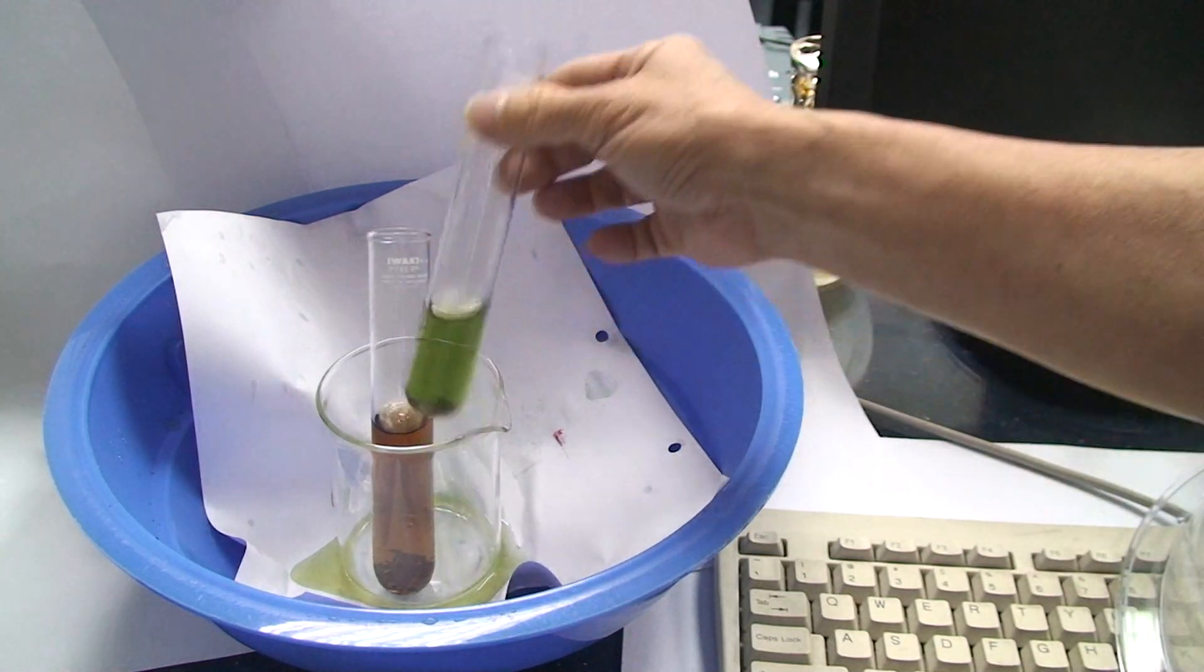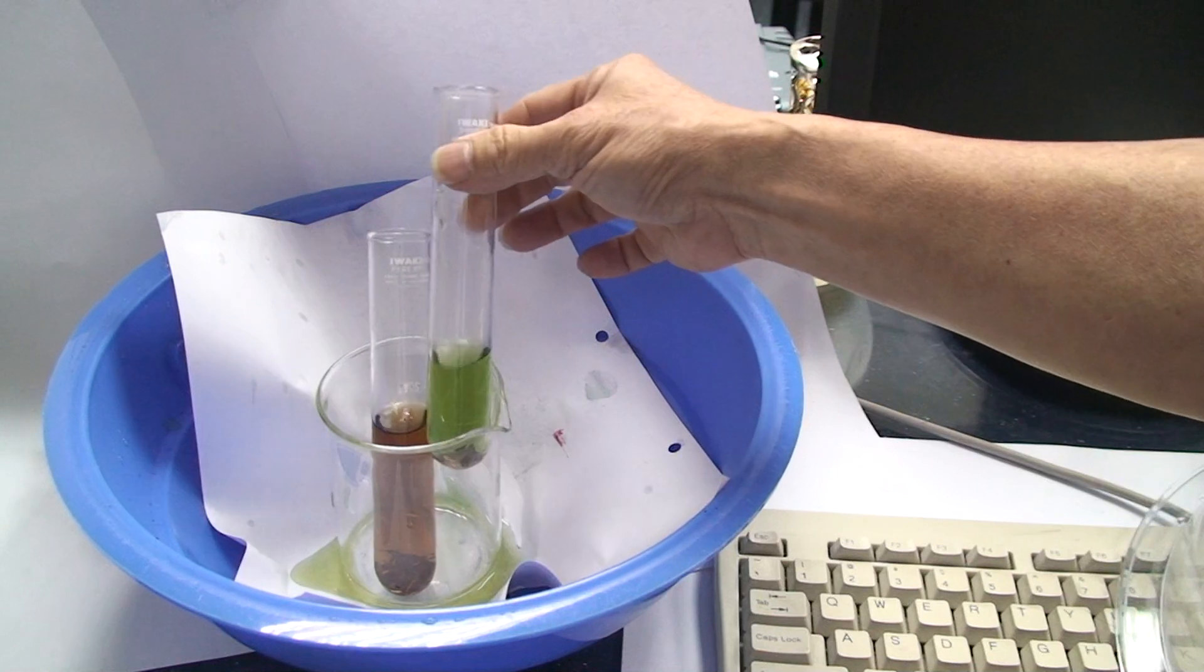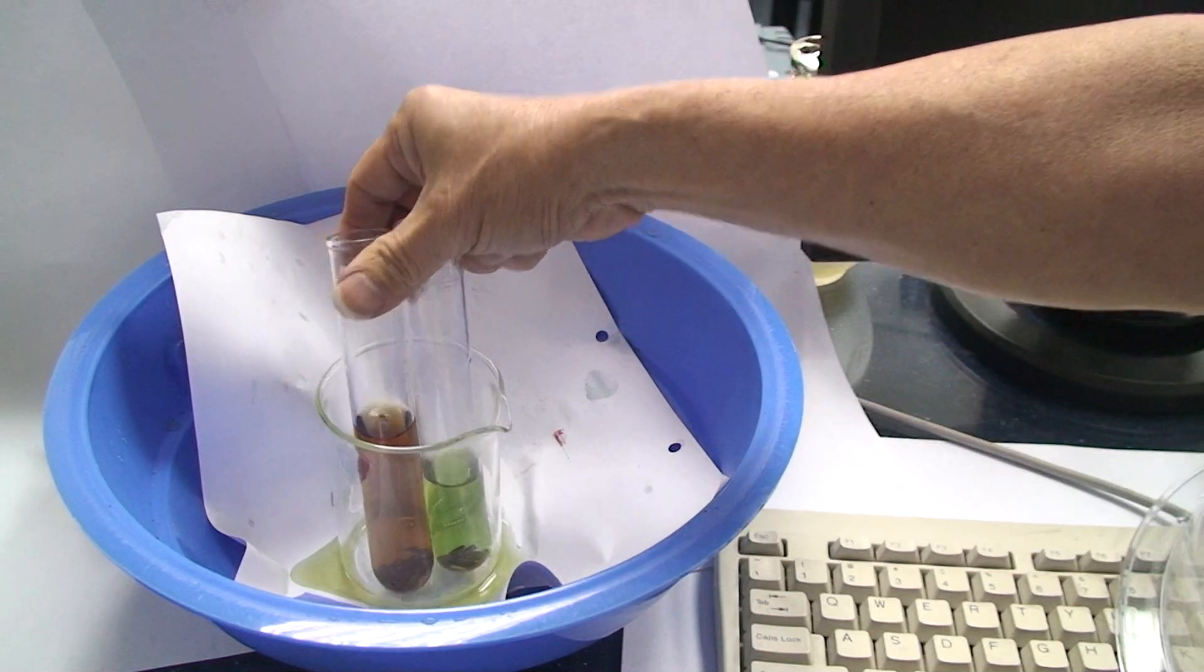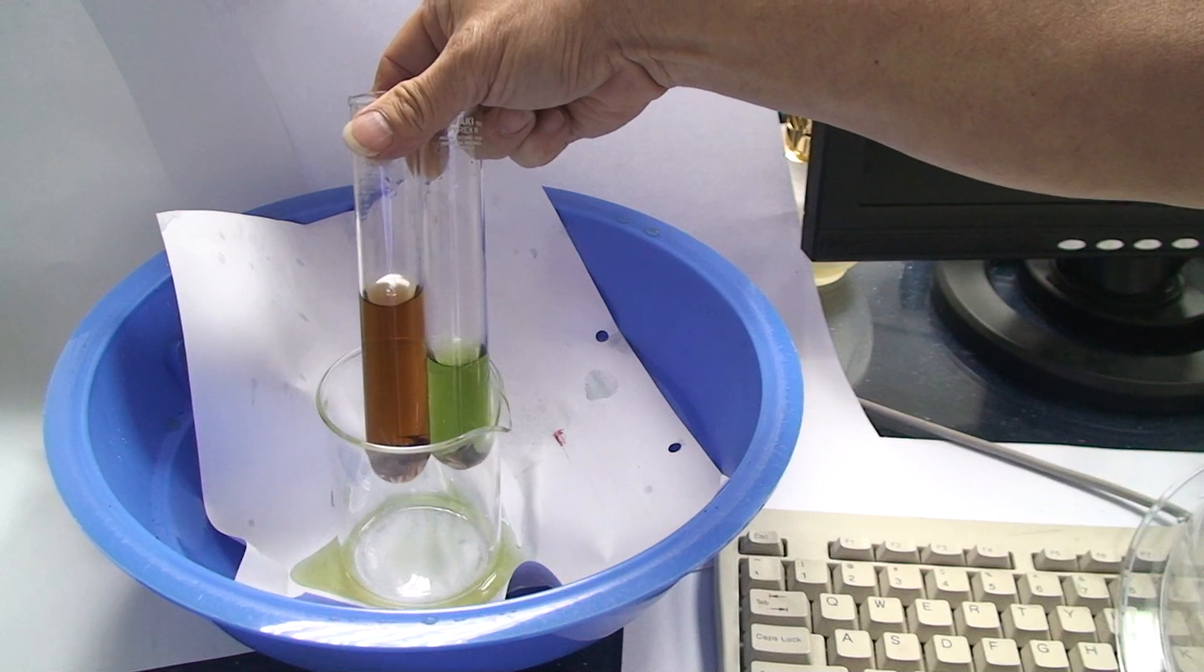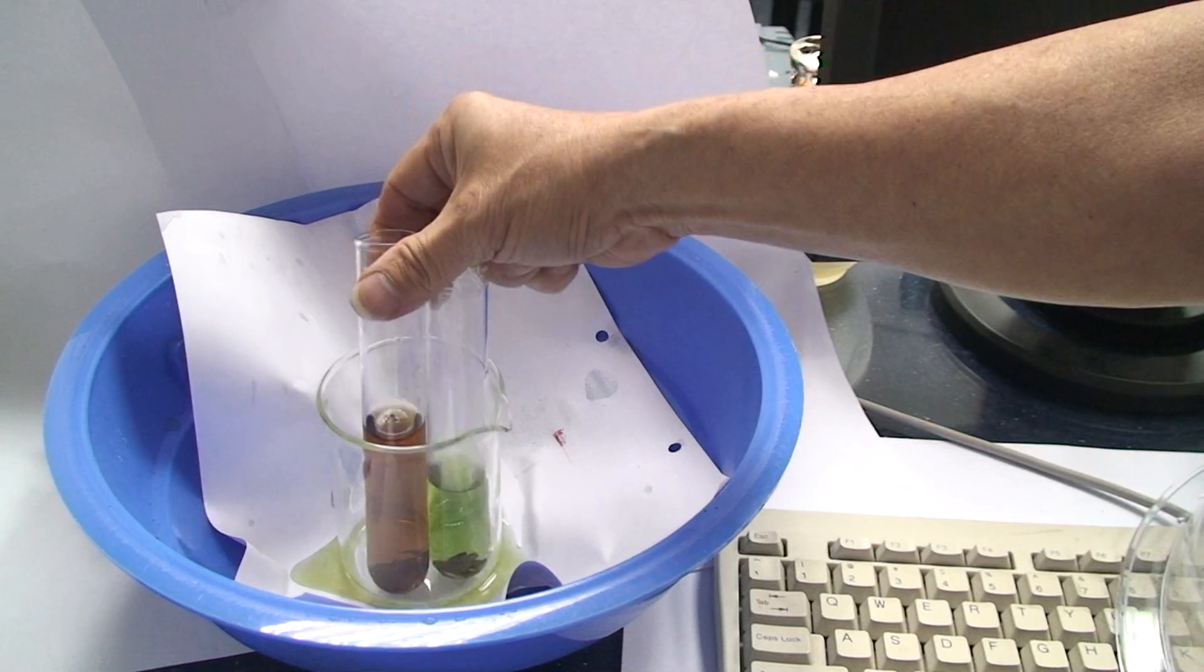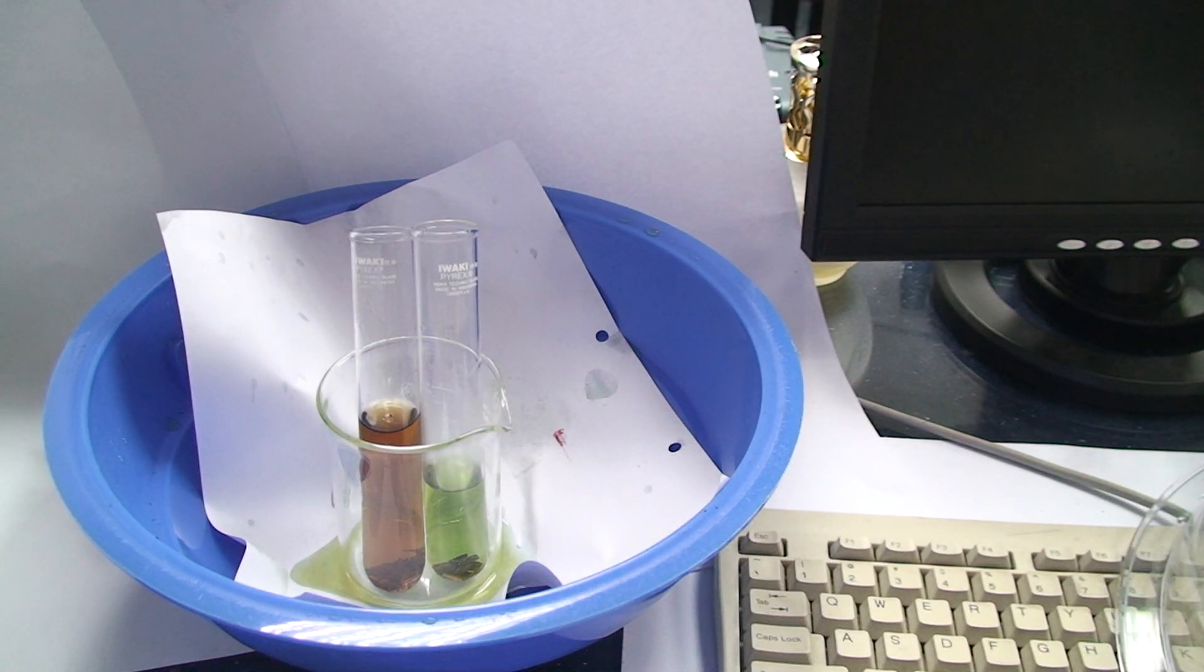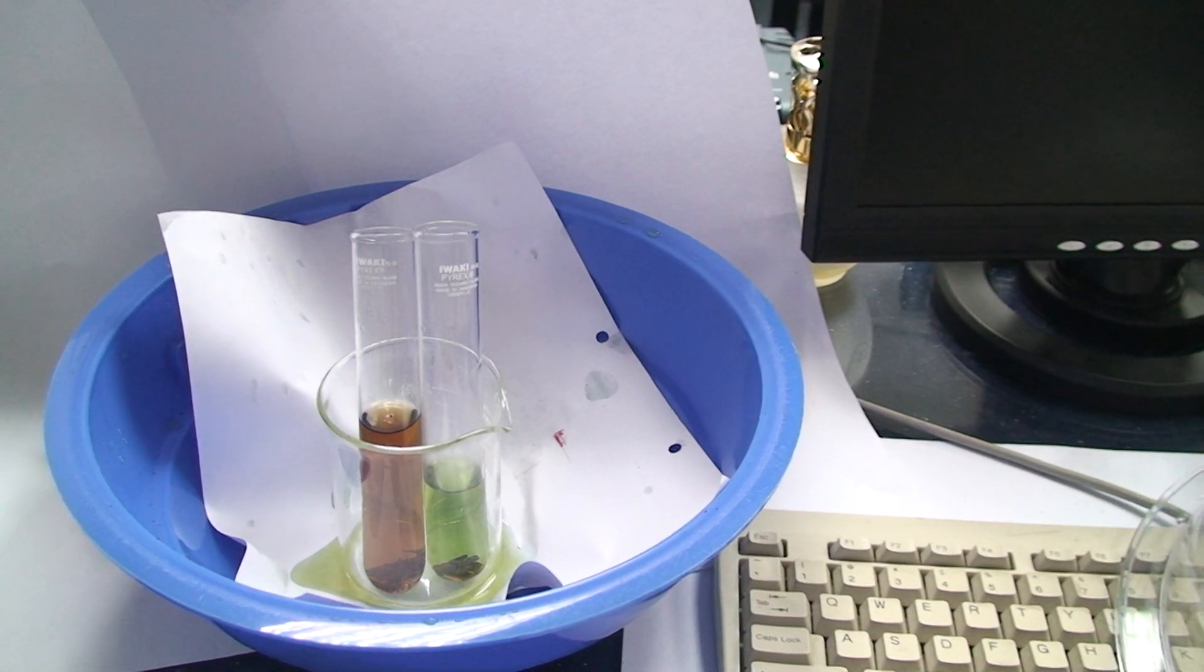And voila, this is green. Yes. And the other one, of course, now it is Coke Light without dissolved carbon dioxide inside. Yes. Thank you. Now, the other one.